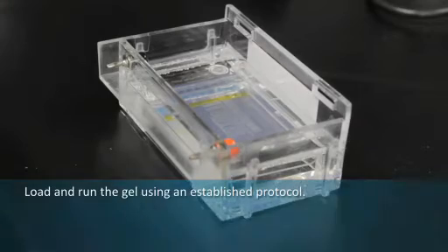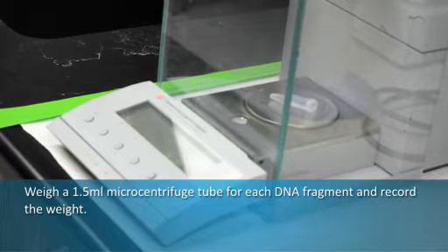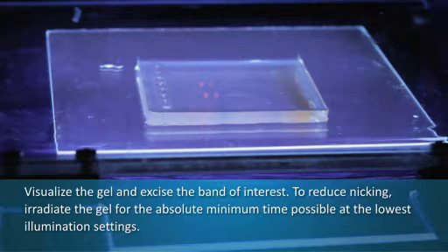Load and run the gel using an established protocol. Weigh a 1.5-milliliter microcentrifuge tube for each DNA fragment and record the weight. Visualize the gel and excise the band of interest.